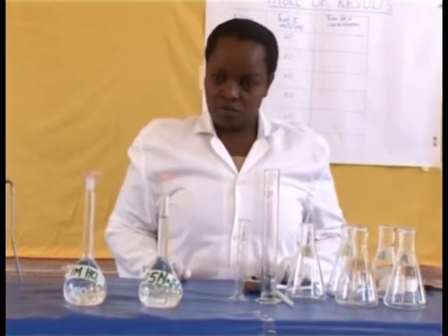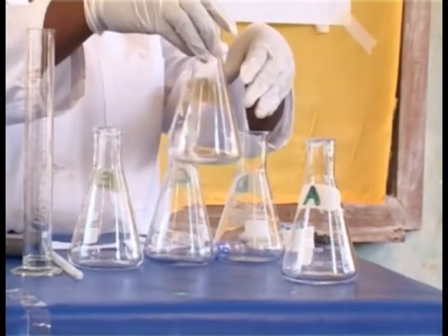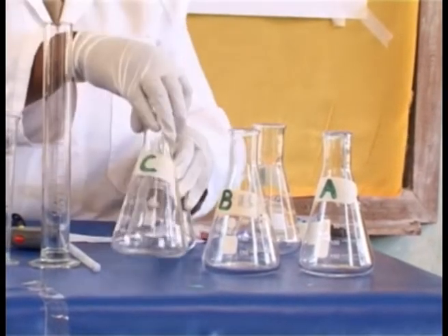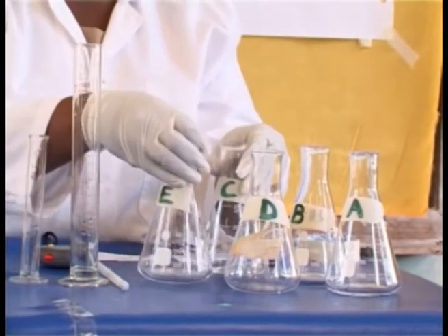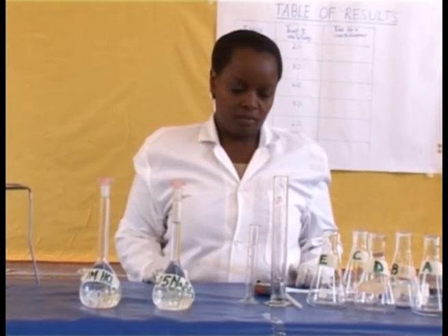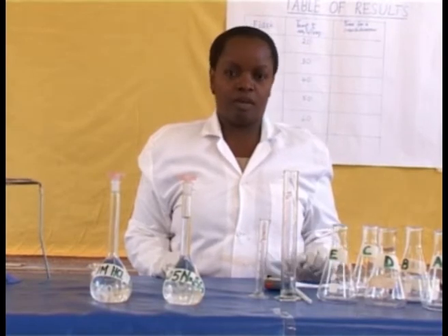Procedure: Label the conical flasks with the letters A, B, C, D, and E.